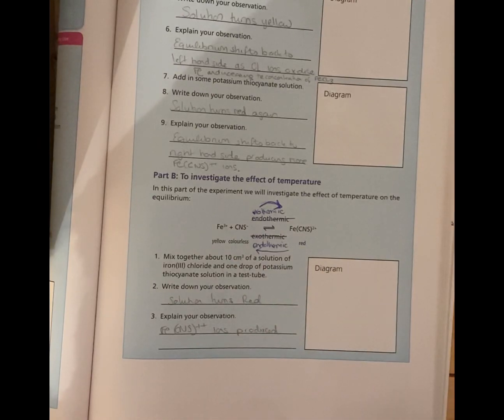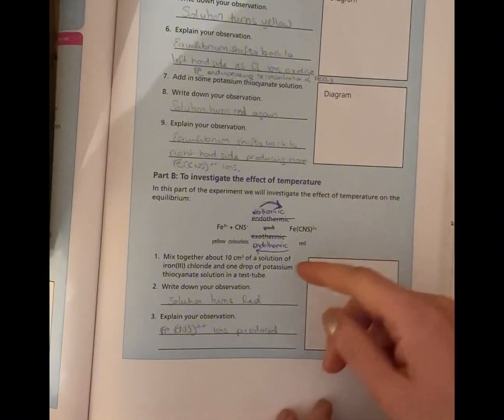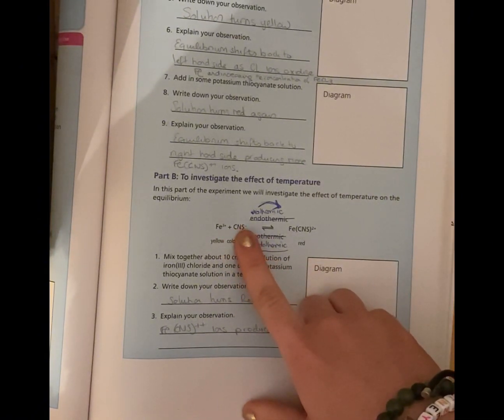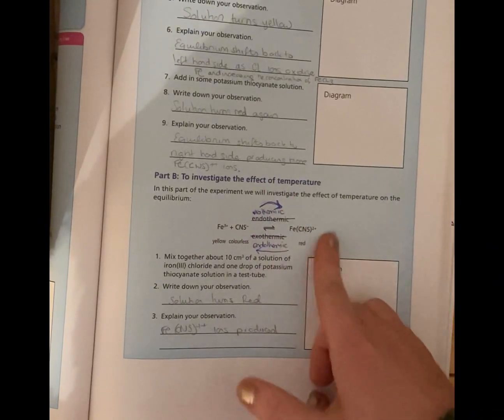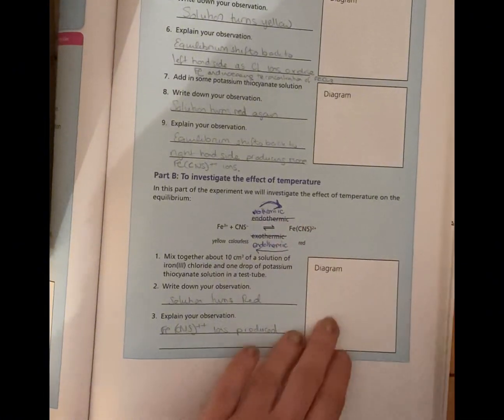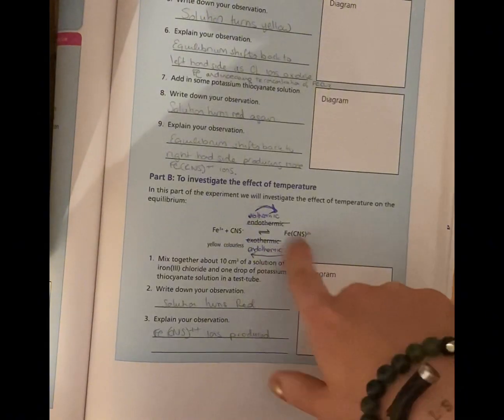Now when we're in the ice bath, again, we're having a different type of stress on the system. We want to balance that by releasing heat to bring it back to the normal temperature. And so we're going to release it through the exothermic energy, this side here. So we're going to go this side instead, and it's going to look like the red solution more so, it should be a darker red. And in the room temperature one, there should be no difference at all. It should just stay the normal red.